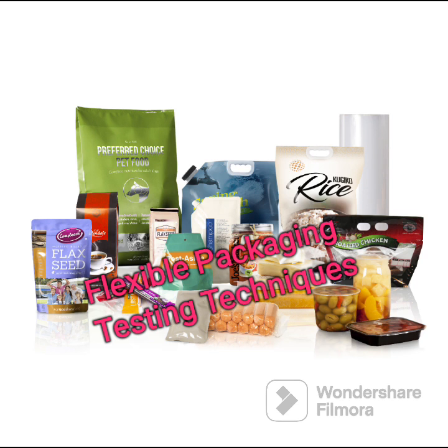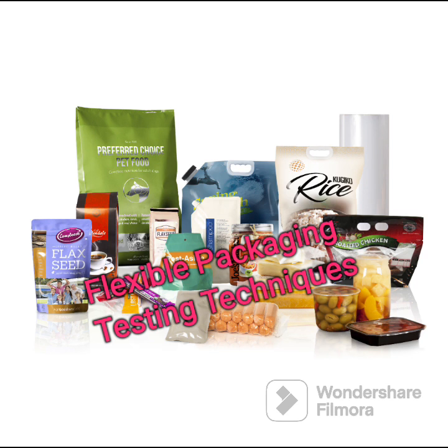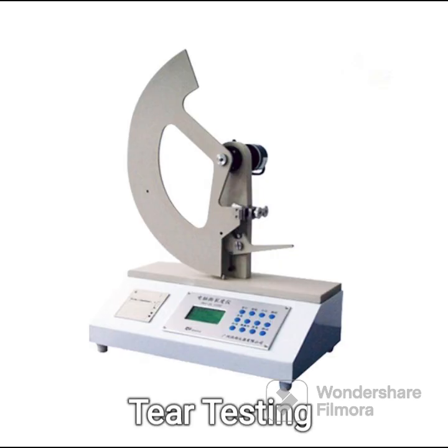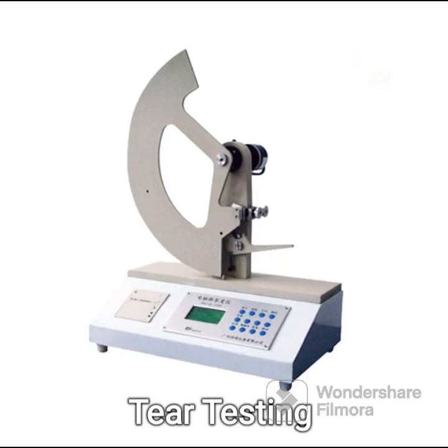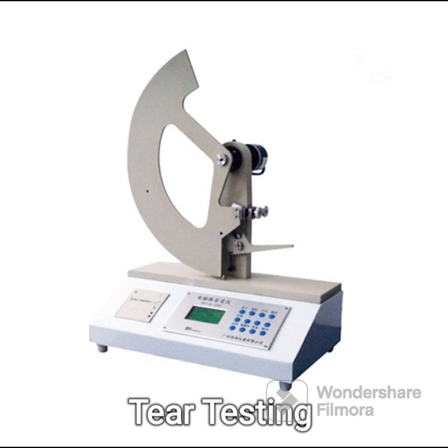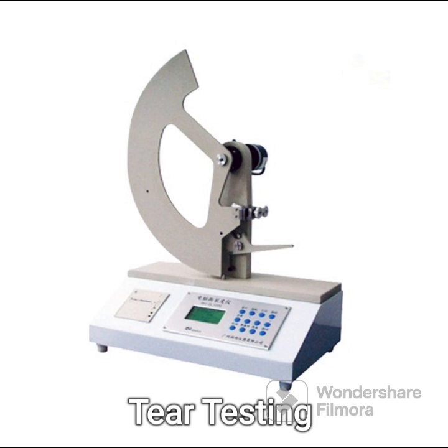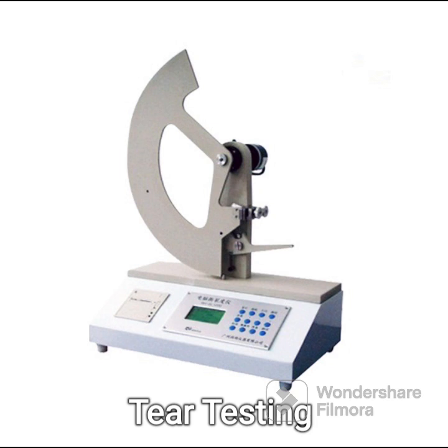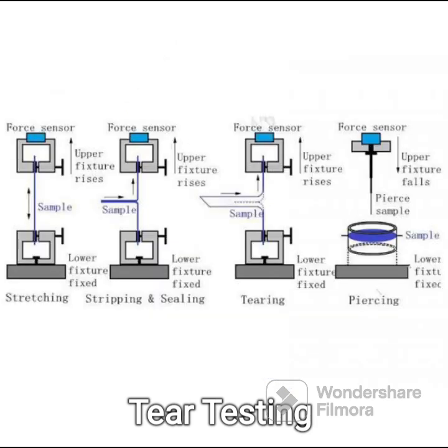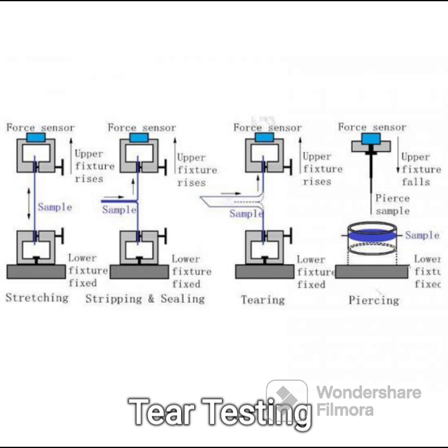Types of testing used in flexible packaging. Tear testing measures the force required to continue the tearing of an initial cut in sheet materials. Models and weights are available to test material with a variety of strengths. This is also useful to evaluate the strength of perforated materials.